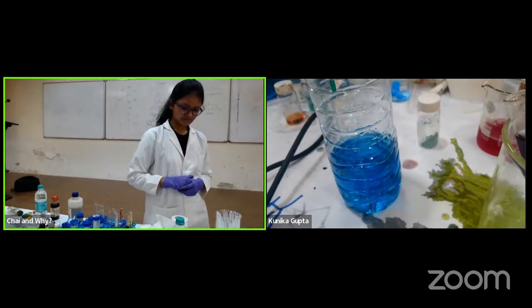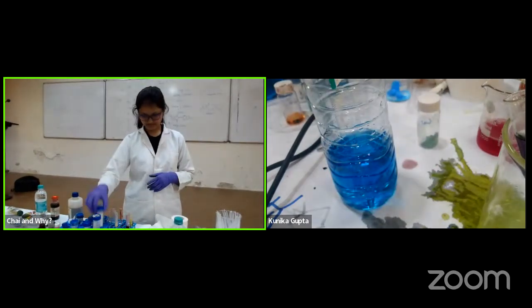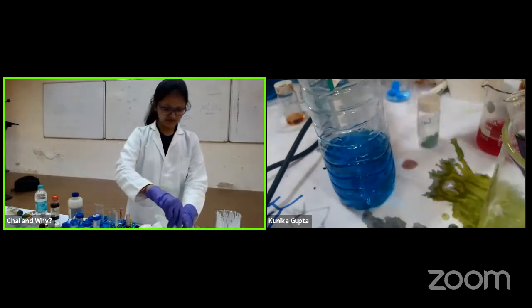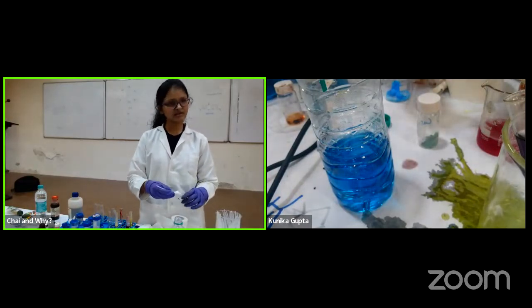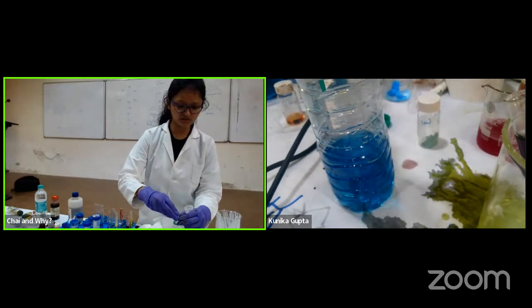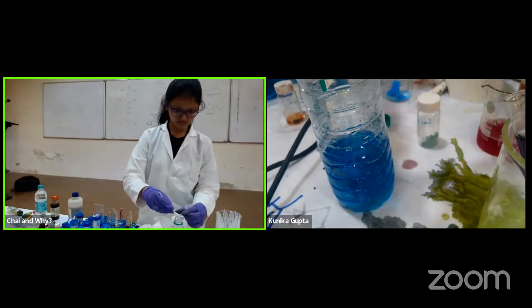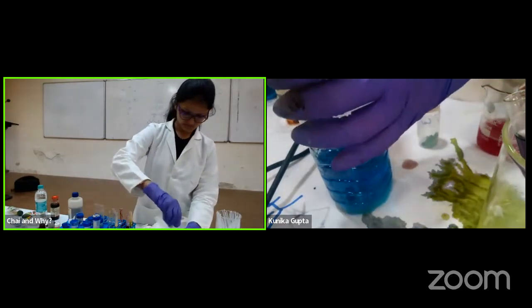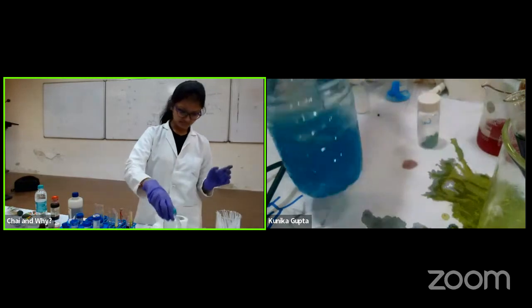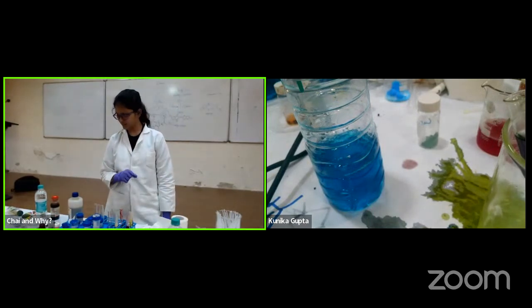It will take some time. I'll make a dilute one if required. Add some glucose. That's the problem that happens when you add randomly. Otherwise, these reactions work perfectly fine if you have a weighing balance and you weigh exactly how much base and how much glucose you need. Let's see if it works out here. Otherwise, I'll add a little amount and show you. It takes some time.